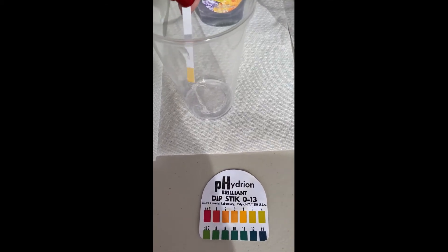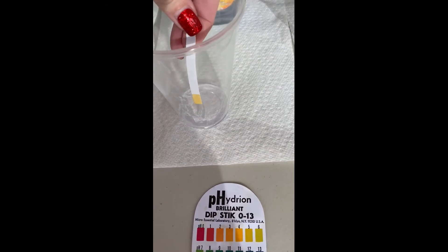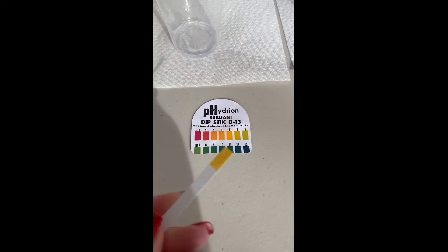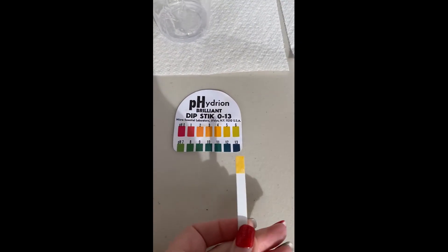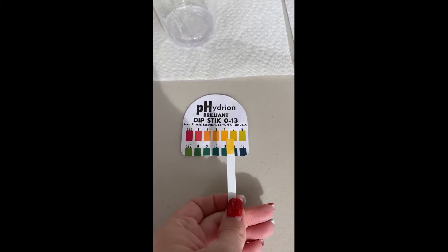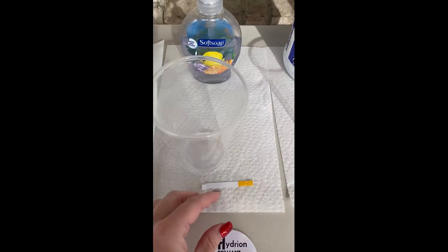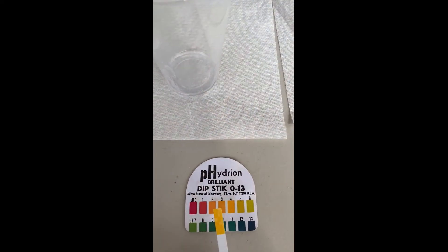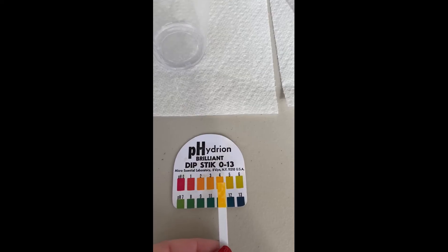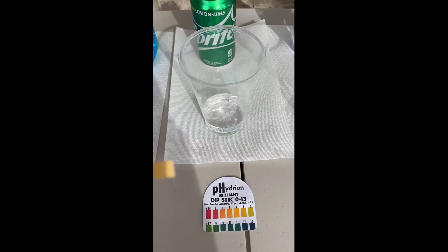Then we have soap — hand soap — and it's actually smeared on the side of the cup, so I'm just smearing it on our little indicator strip. It's not turning colors instantly, so I let this one have some time to develop in color since it is such a viscous substance. This is what it ended up looking like, and you can see the spots where it had the soap, and it matches up around a 4 pretty well.